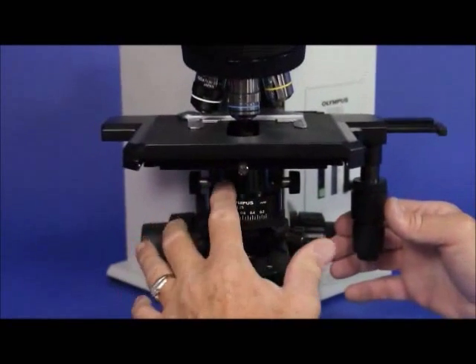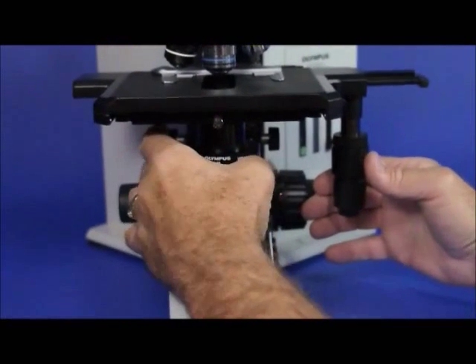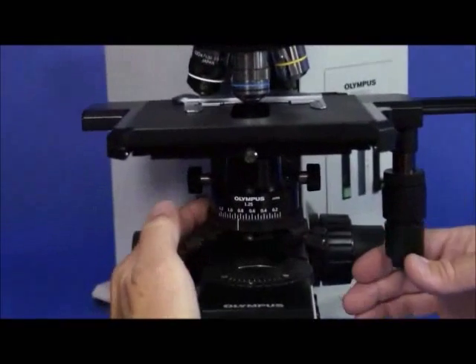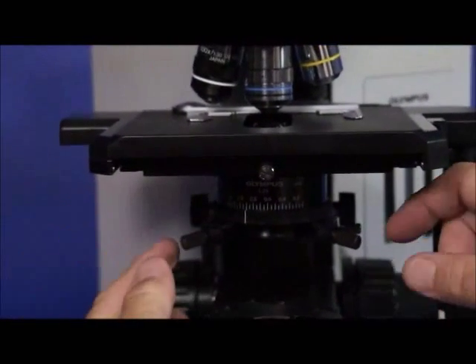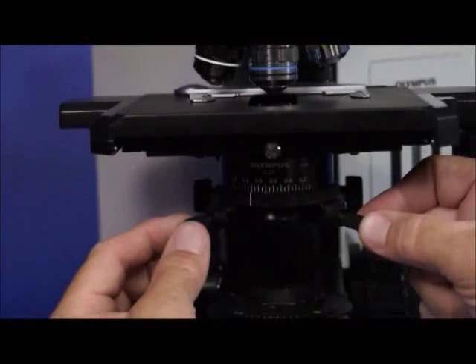Moving down, we have an Olympus brightfield condenser with an iris diaphragm, and it's focusable and also centerable with these two screws.